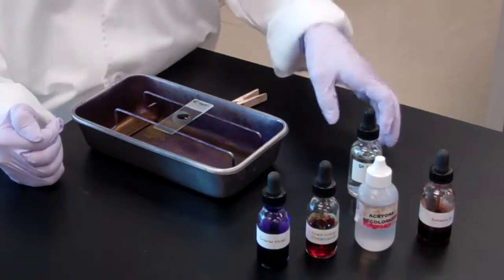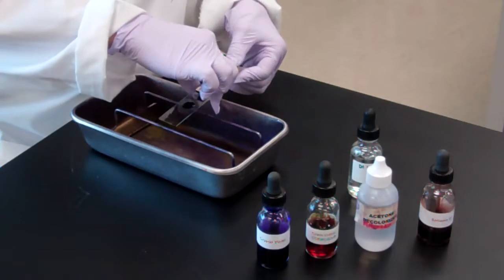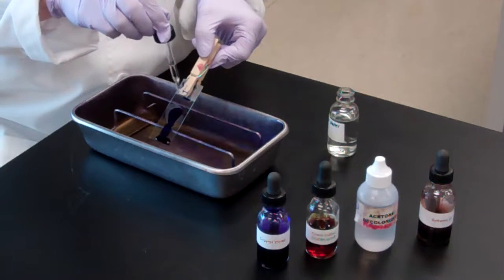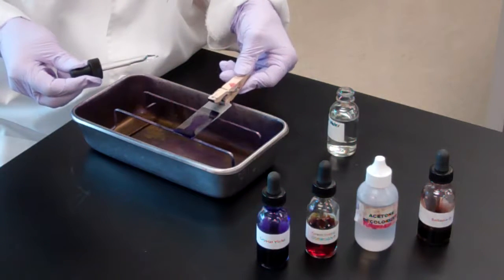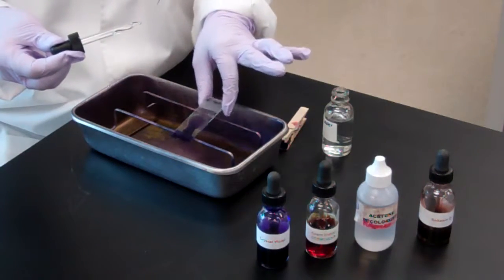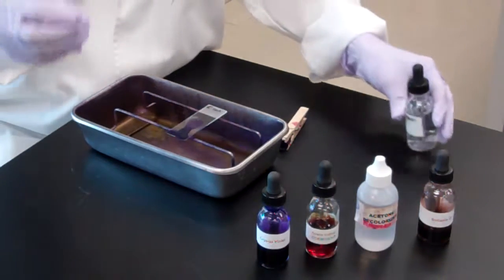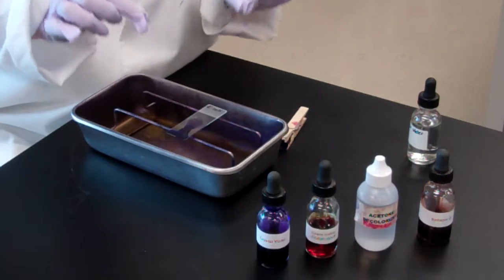It sits for 1 minute. After that 1 minute, you can either hold the slide with your clothespin or with your fingers. You'll take your distilled water and rinse that slide. Hold it at an angle and let your water drop, and you're done. If you look at this, I still have some crystal violet. It does not need to wash off all the way. You don't need to have a perfectly clean slide. So with this crystal violet, regardless of whether you have a gram-positive or gram-negative organism, the bacteria appears purple.